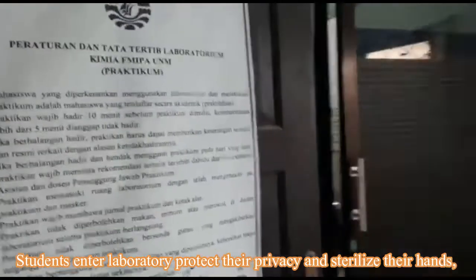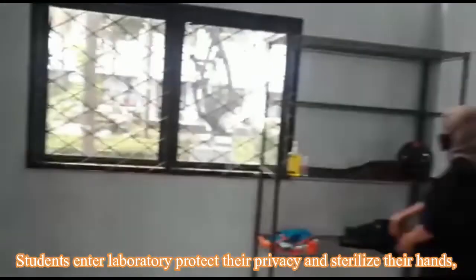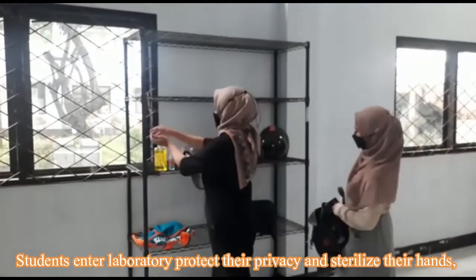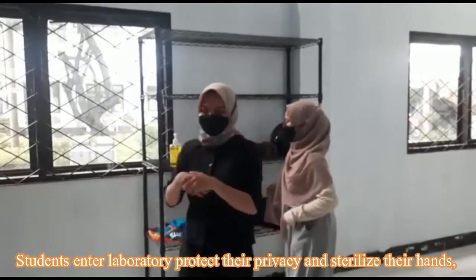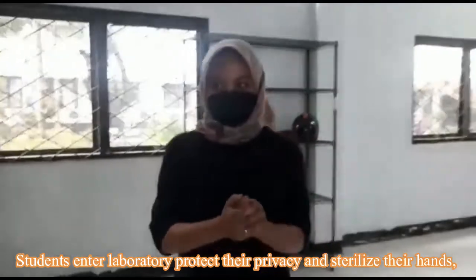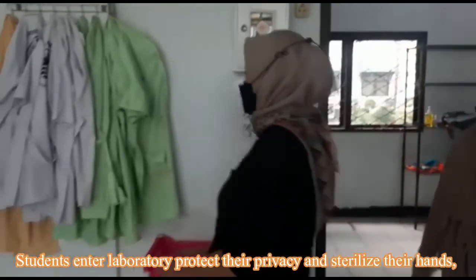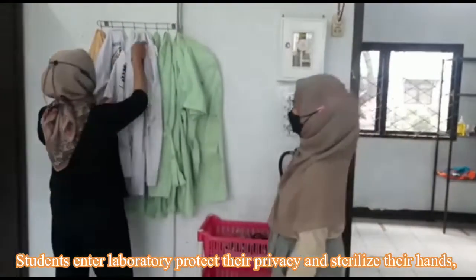Besides simple practicum, students also do practicum using advanced instruments such as HPLC, UV-visible, TLC, conductometer, flame photometer, turbidimeter, refractometer, mercury analyzer, and other instruments.